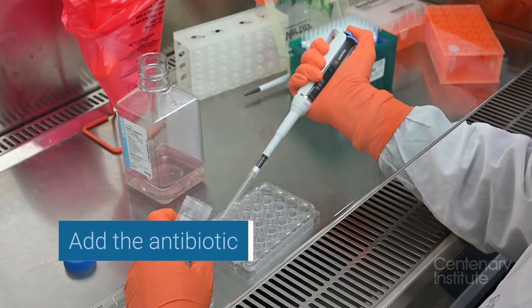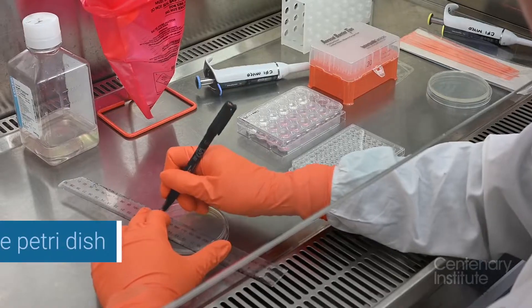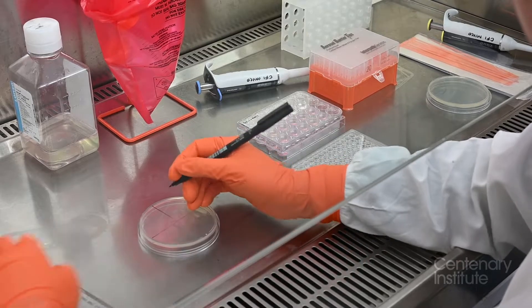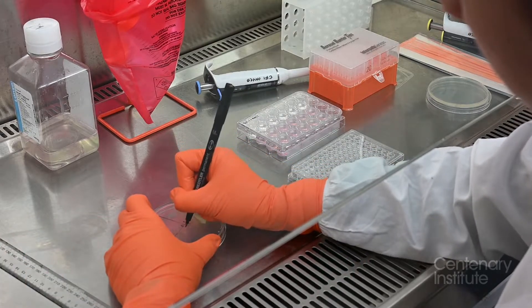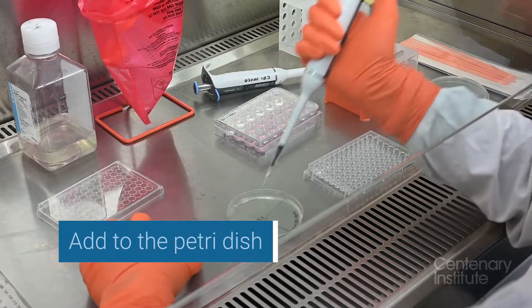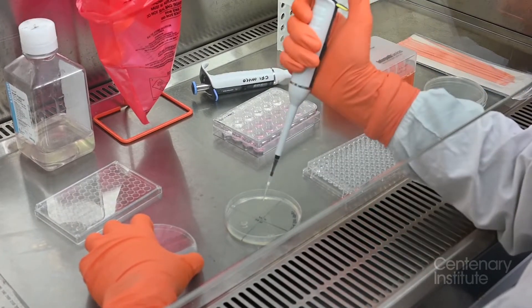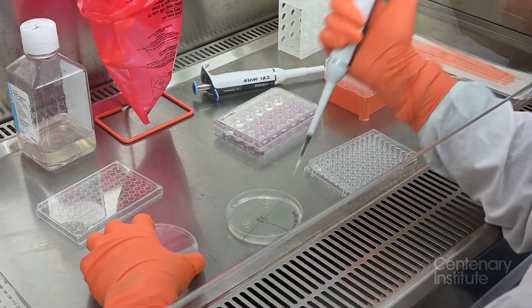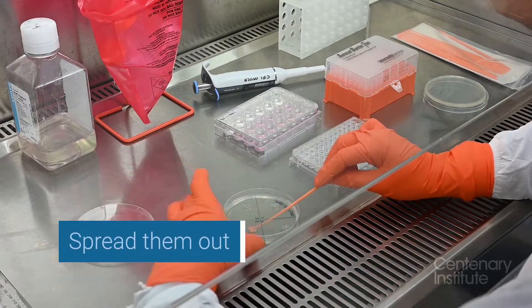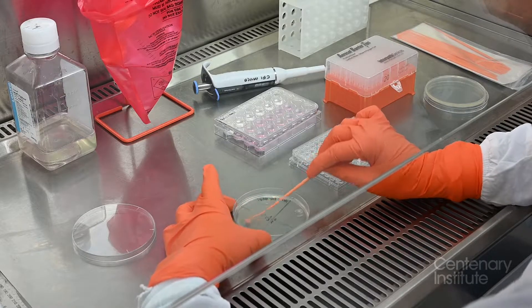Next we add antibiotic to the cells. Then it's time to put them onto a petri dish. We're using different dilutions — you can see here I'm putting them on four different sections of the petri dish. We spread them out to ensure there's not too much or too little bacteria for us to count.